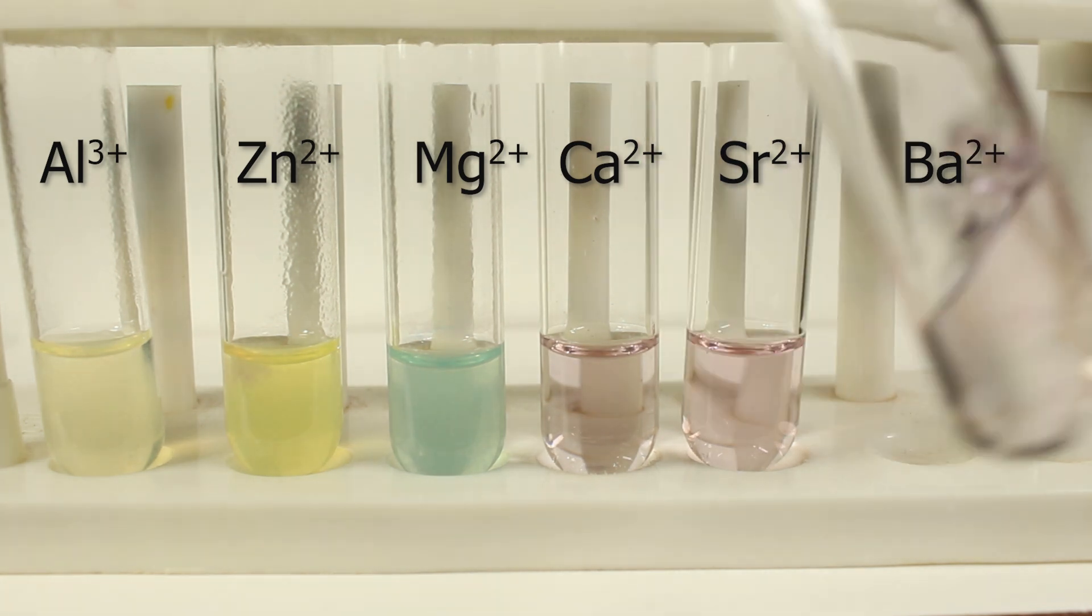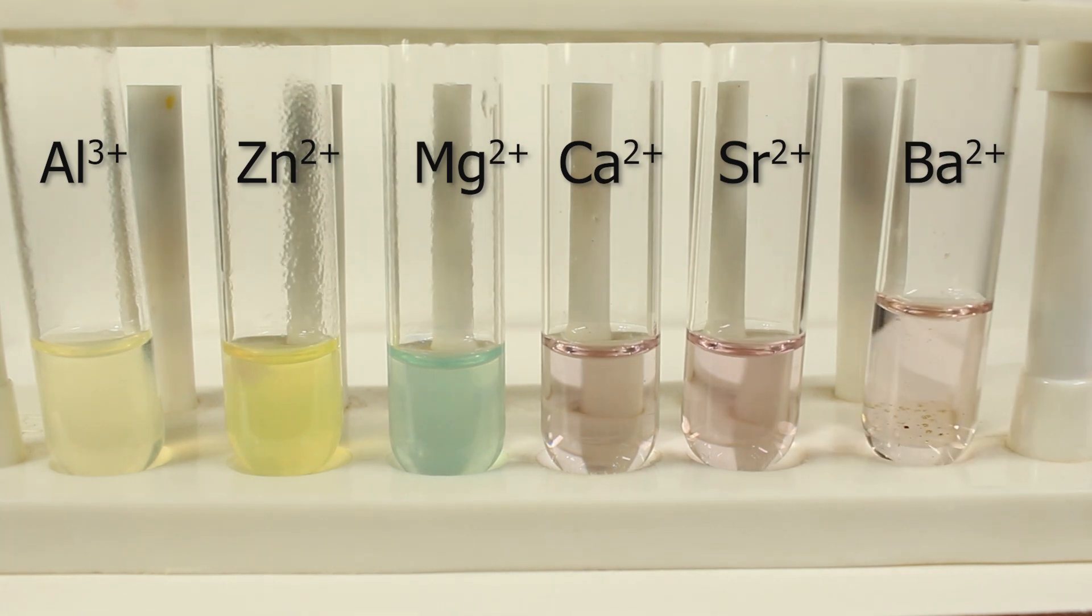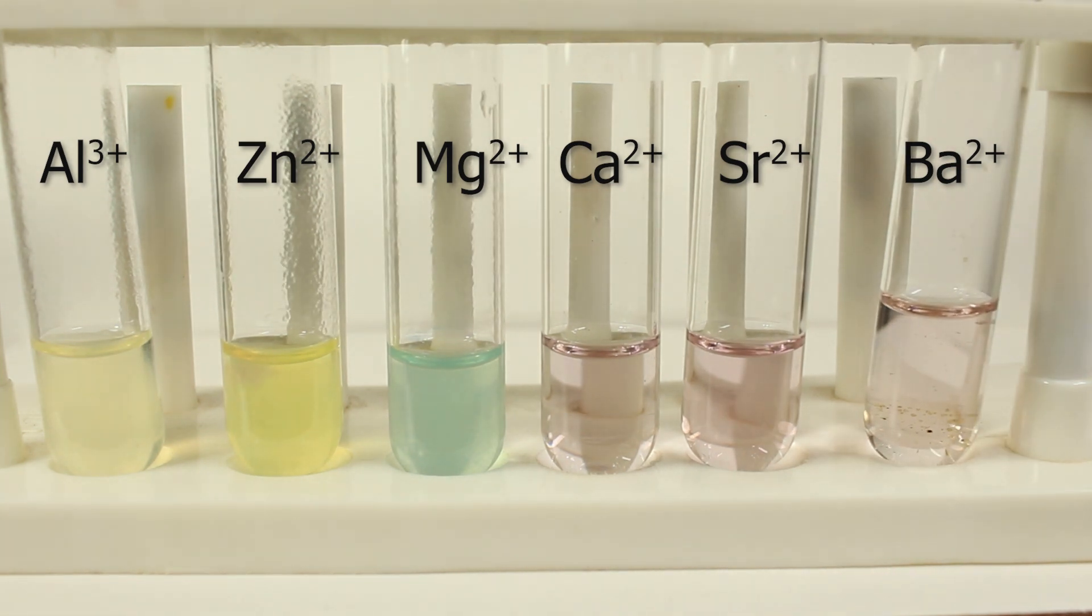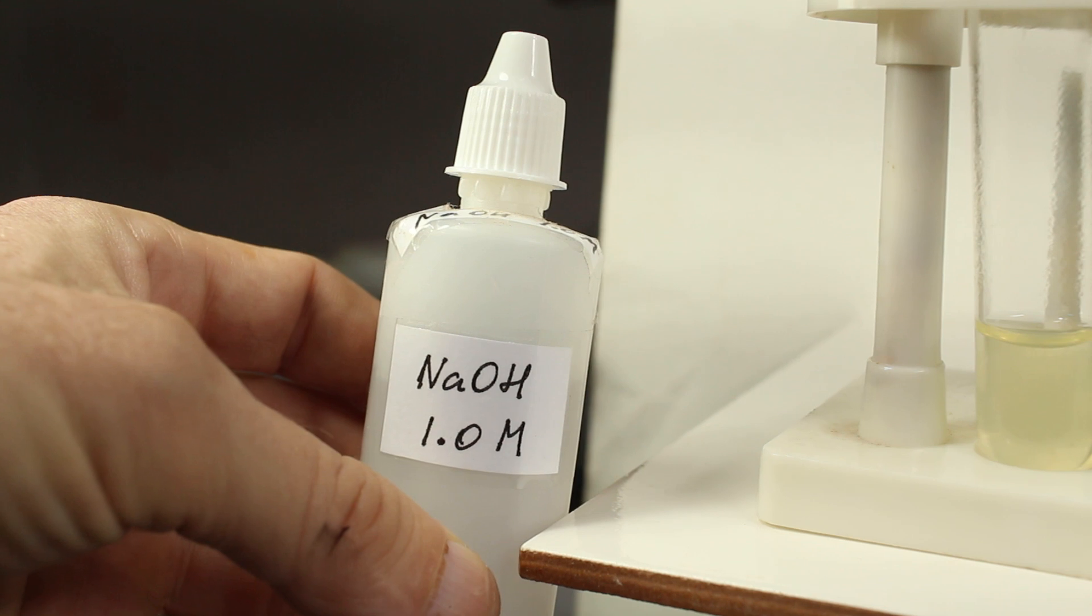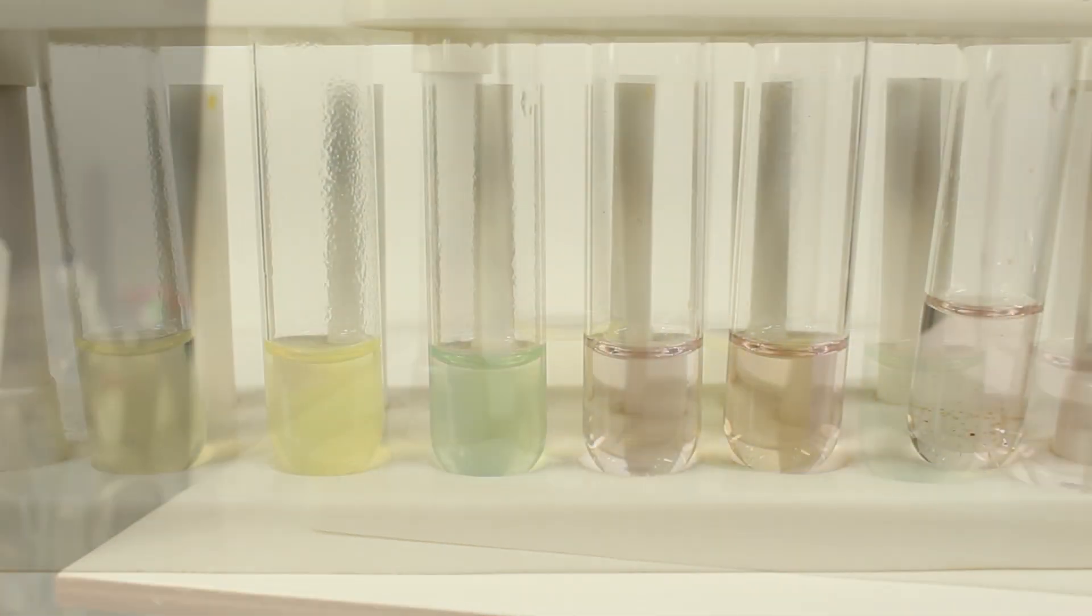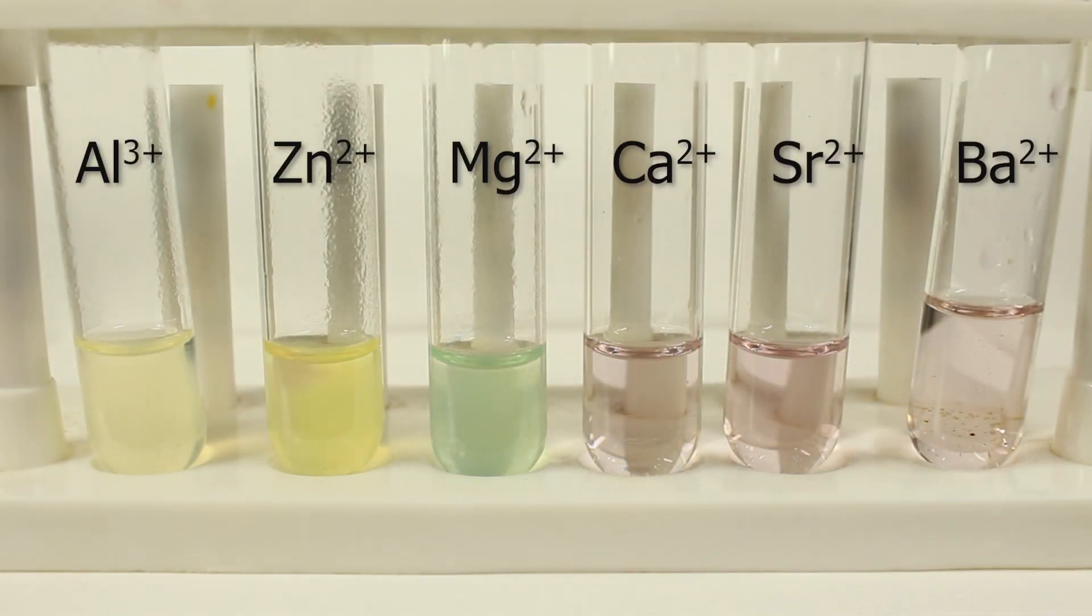Calcium, strontium, barium. Violet color. Simply very dilute. To get the color more natural I have to really be sure that my pH is somewhere really above 13. So I am adding 3-4 drops of sodium hydroxide in each of these.